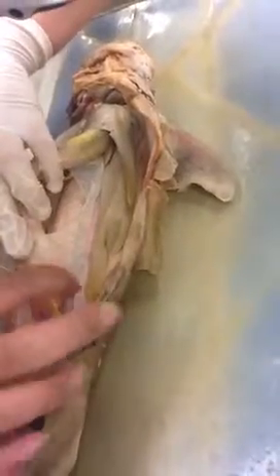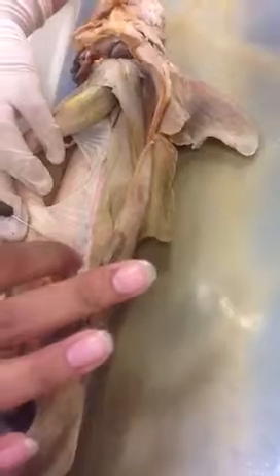The ones running across are your annular arteries. And this is your posterior, actually, if you pull up this way. You have to be a little careful. The first branch is actually your posterior. If you trace it up, it is your posterior intestinal artery, which is the one that meets up. It's best to look at it this way because they cross over. So this one right here crosses over, and that's the posterior intestinal artery.